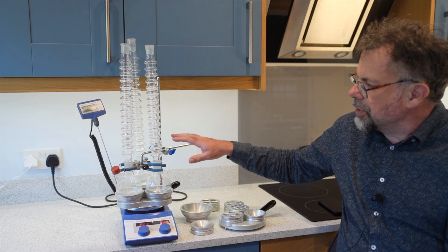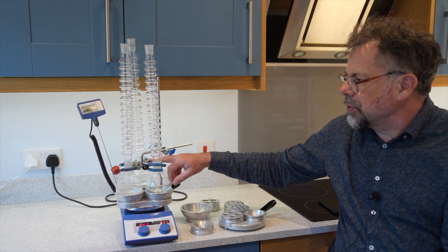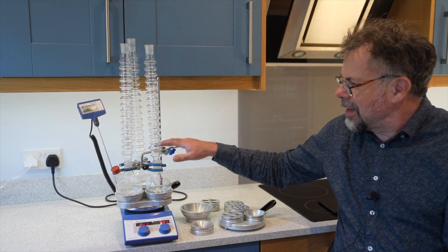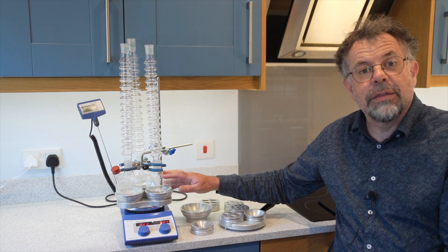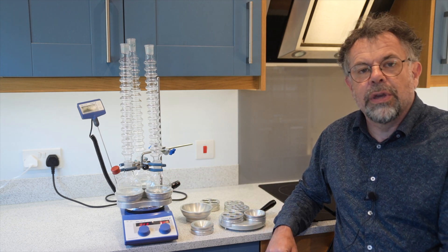Here, to keep things tidy, we use a very unique three-position clamp. These are optional but we certainly recommend purchasing this device. It clamps onto a normal retort rod and keeps the three flasks held securely. It also allows you to remove them from the heat at the end of an experiment, or in case of an emergency, quite quickly.